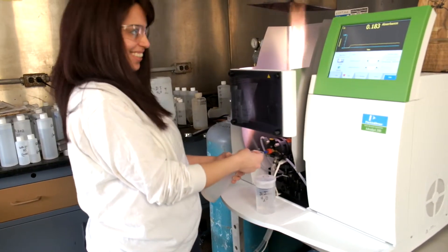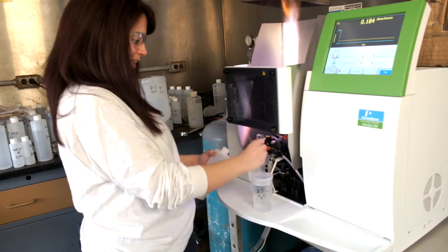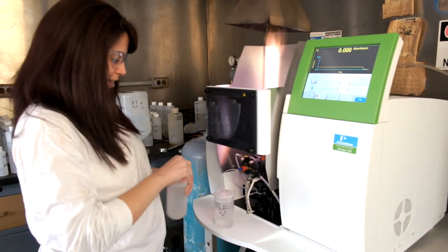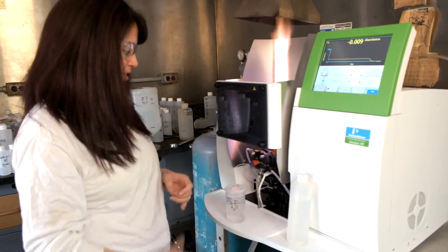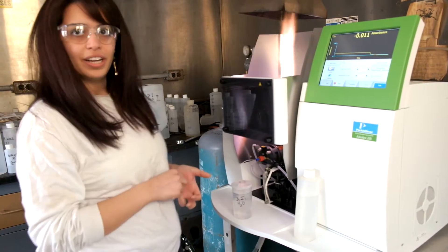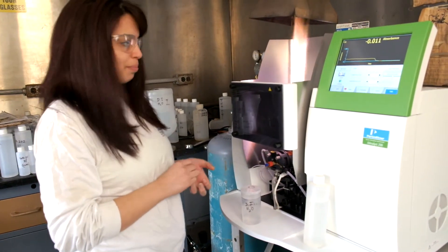And so why would you use this device? Is it more accurate than other methods? It has low detection limits and it has a pretty wide range of measuring metals. So it's pretty accurate.